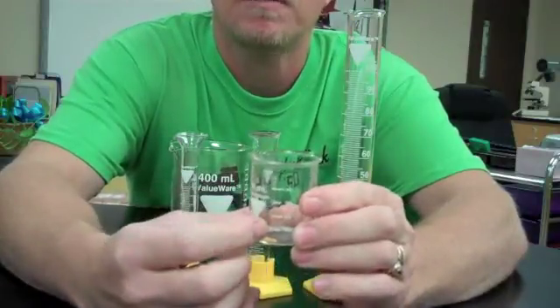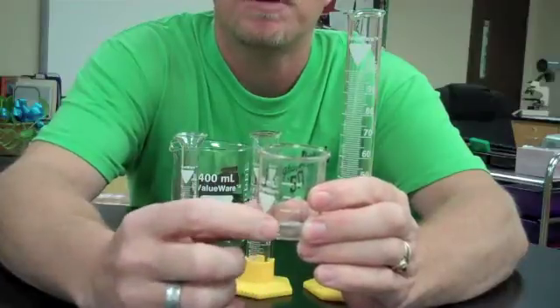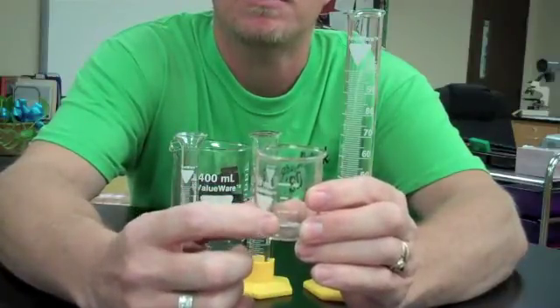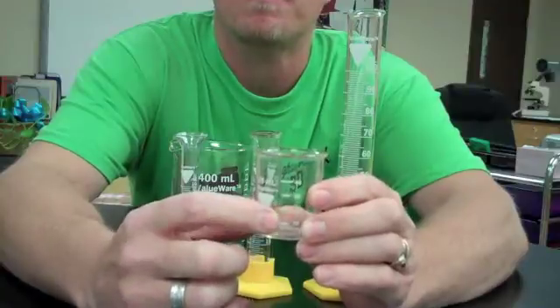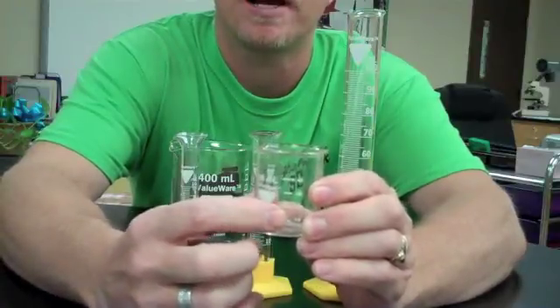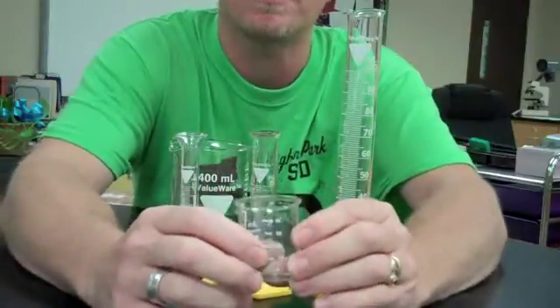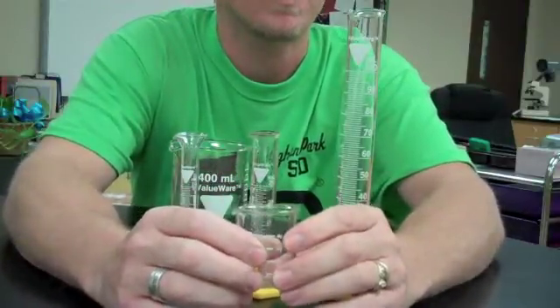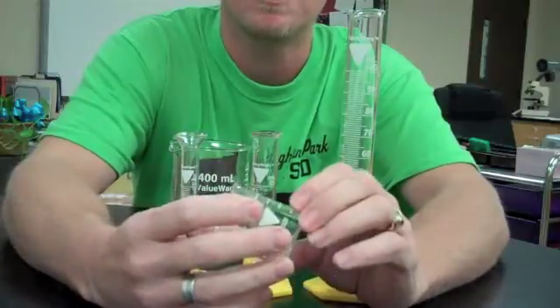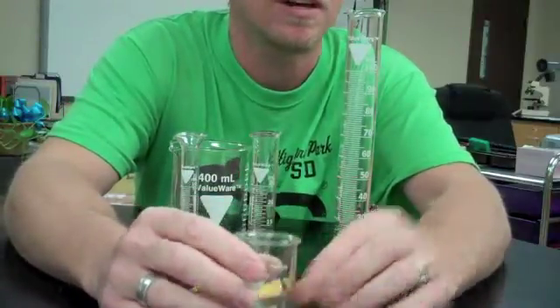If we look, the lines actually go from 10 to 20 here. So between the 10 and 20 mark, we have basically 9 milliliters that really don't have a mark to account for. If we fall between those lines with a fluid we are trying to figure out, then we are left to guess. And guessing, of course, is not good in science because we want to make sure we are accurate as well as precise.